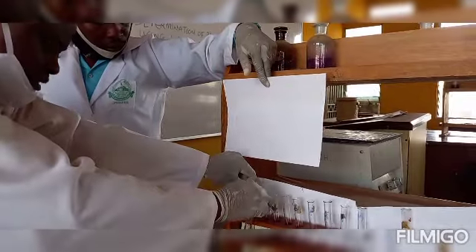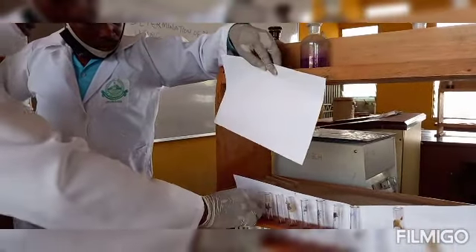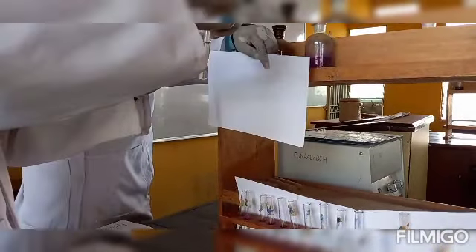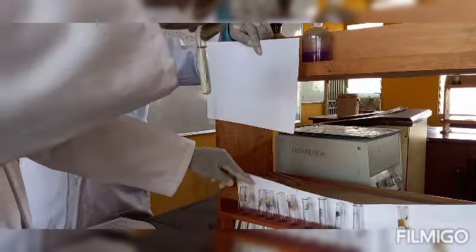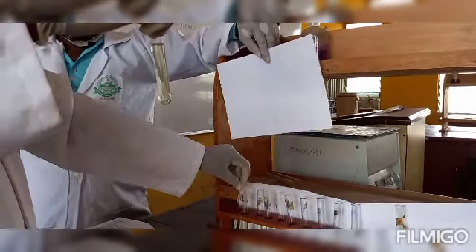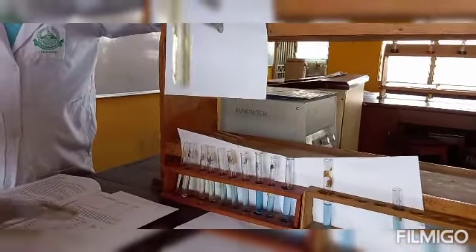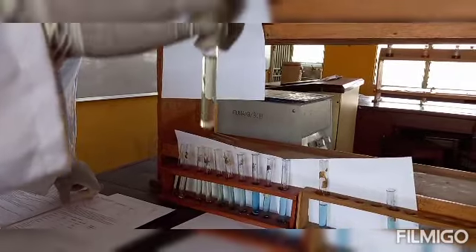With this, you estimate the pH of this urine sample to be the same as the pH of standard test tube 2. If you go back to your manual, test tube 2 stands for pH of 6.2. So automatically we have been able to deduce that the pH of the urine sample we used for this practical procedure is 6.2 or around 6.2.